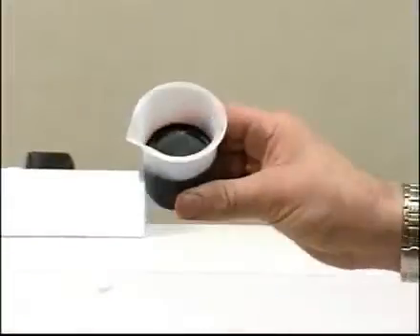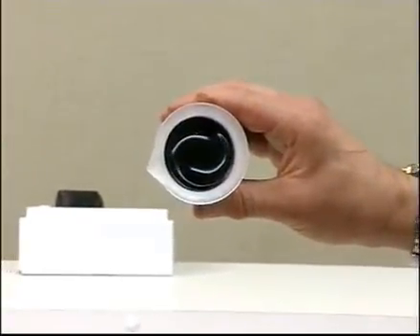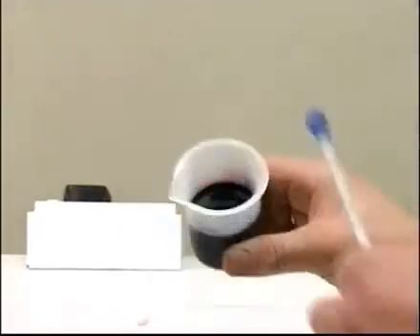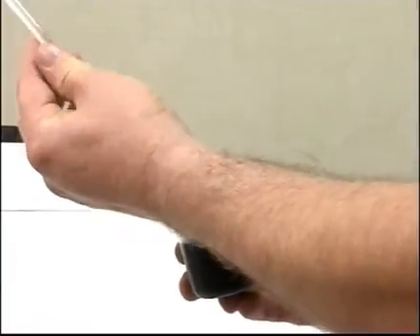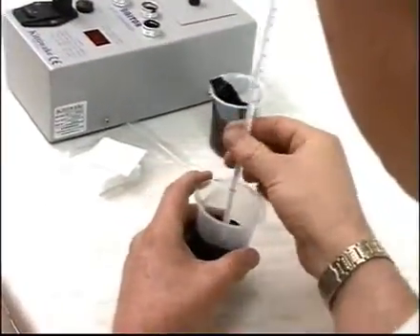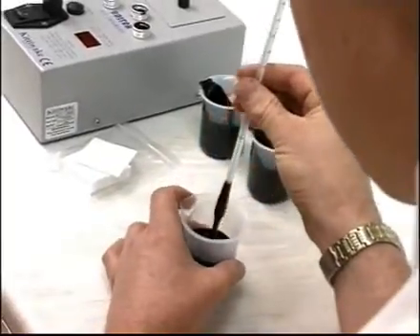The pour point is reached when the oil surface stays in the vertical position when tilted for a period of 5 seconds and does not sag. At this point, insert the thermometer for around 10 seconds and take the temperature of the oil. The pour point is 3 degrees Celsius higher than the temperature reading on the thermometer.